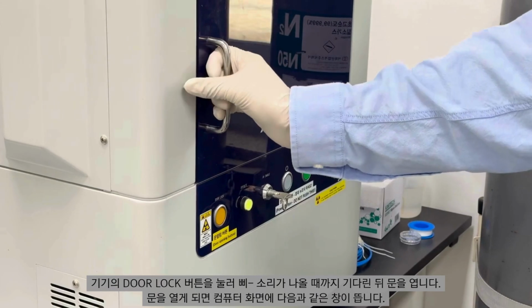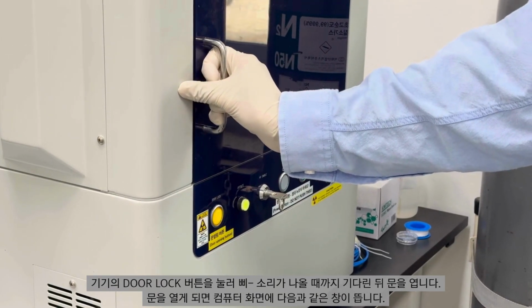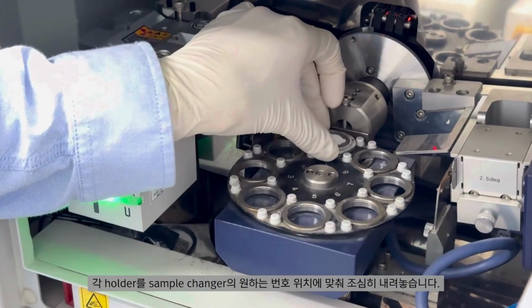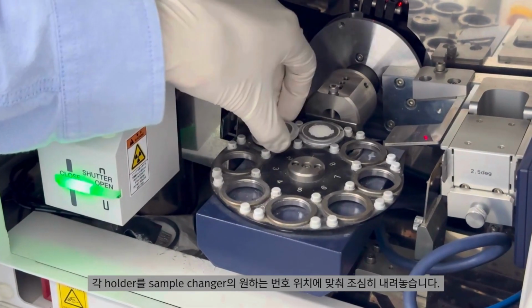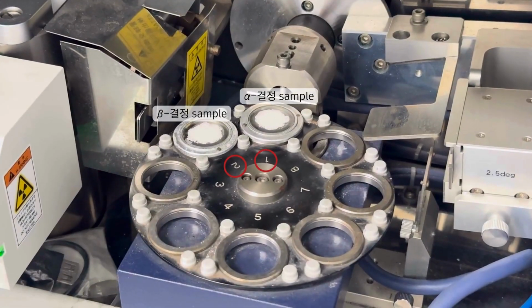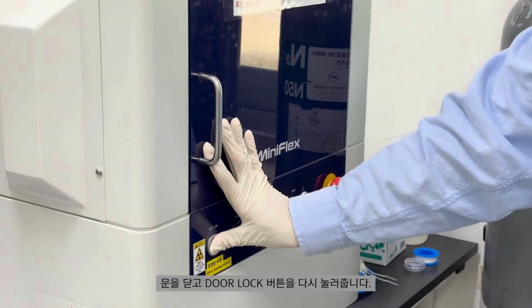Press the equipment's door lock button and wait for a beep sound to open the door. When you open the door, the following window appears on your computer screen. Carefully put each holder into the desired number position of the sample changer. Close the door and press the door lock button again.